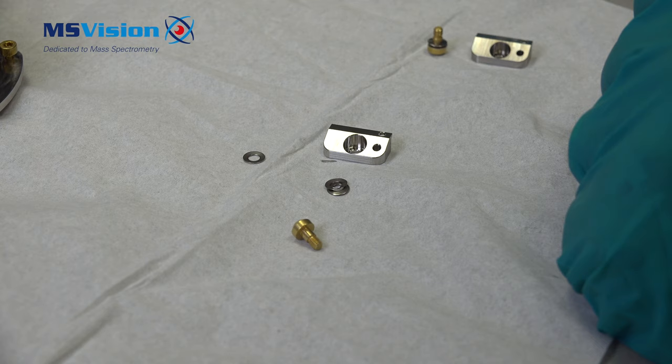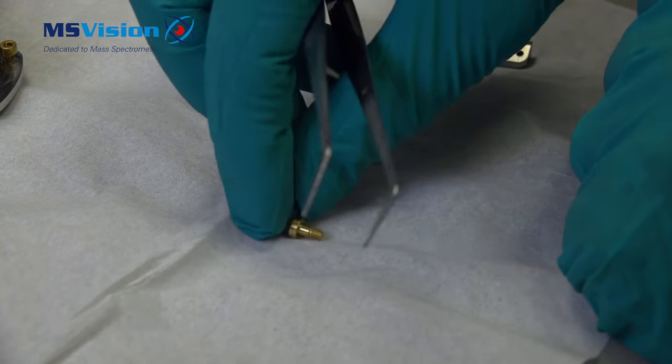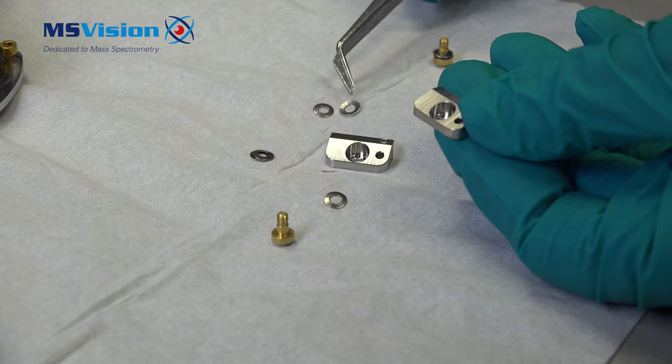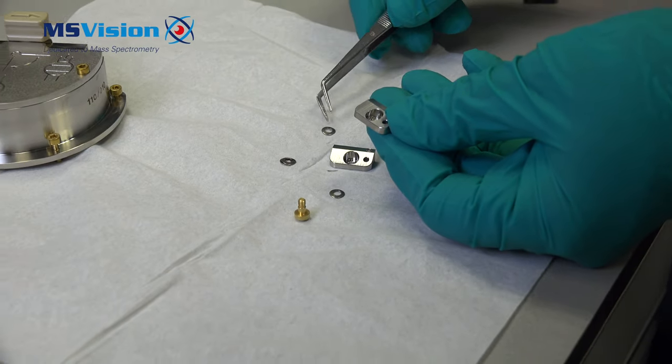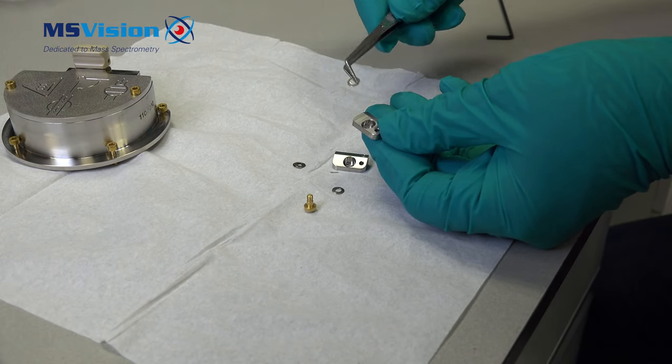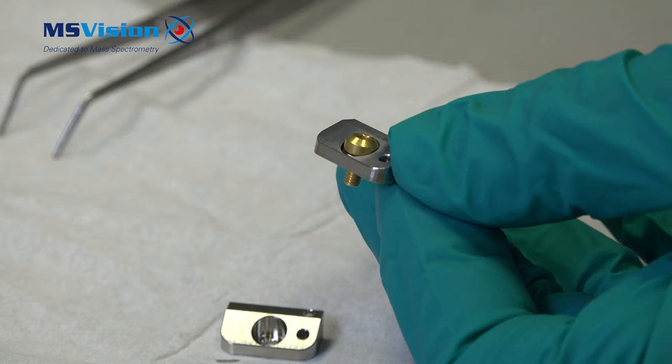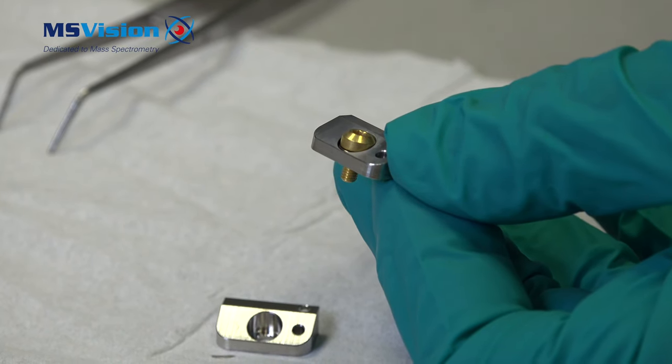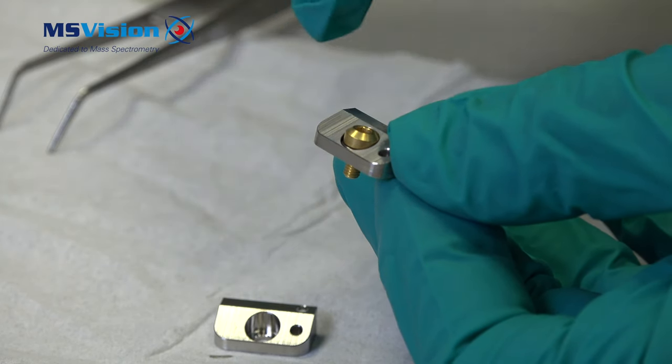We have several washers here and if you look carefully we put the washers at 180 degrees on top of each other. This will act like a spring. When fitted under the screw it will be tightened with a spring like compression and this should be able to allow the cone to be fitted securely.